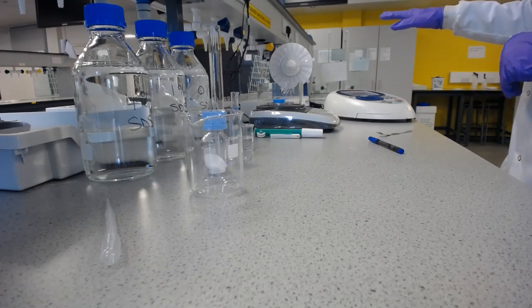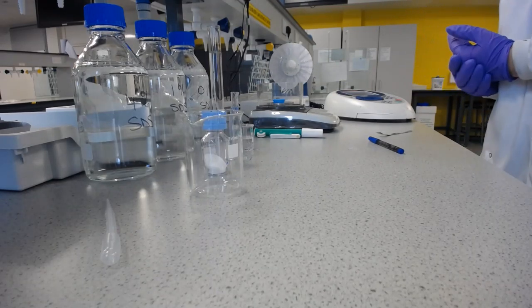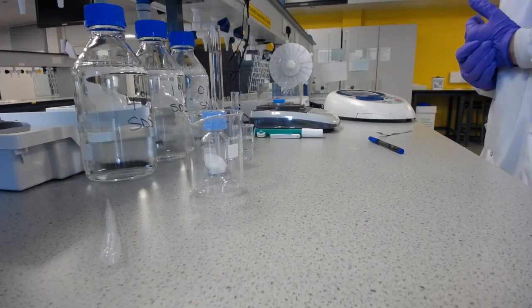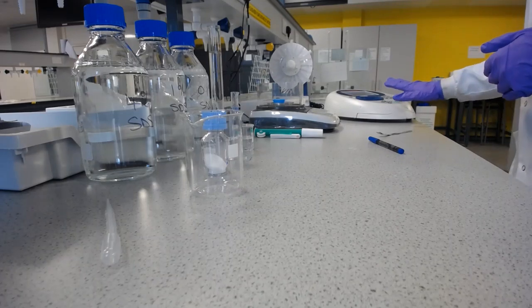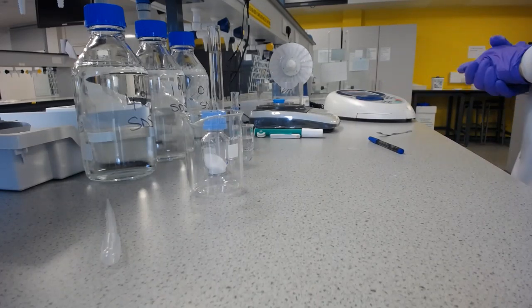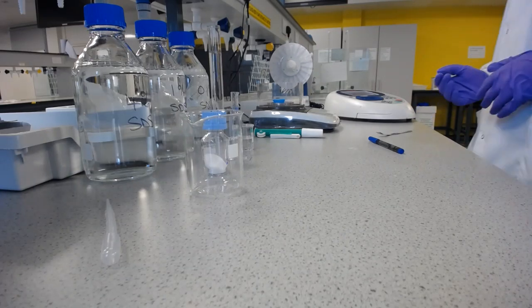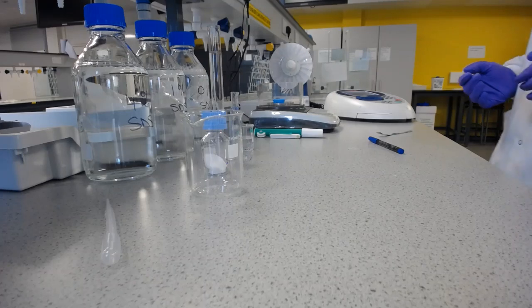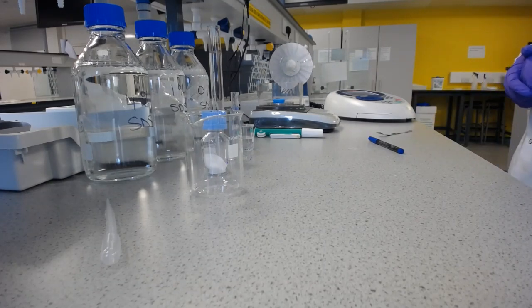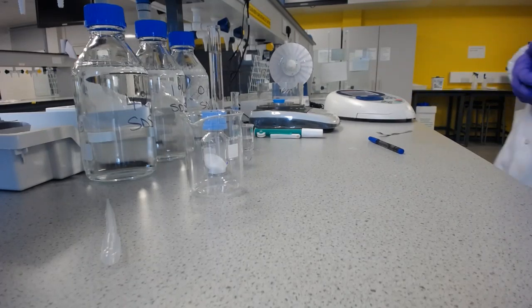So now they're mixing. When they're done, we're going to want to be able to determine how much aspirin is in each solution once we've filtered off the excess. And to do that, we're going to use the UV-Vis spectrometer, and we'll dilute the solution, put it in there, and we'll get an absorbance reading. But the absorbance reading on its own is no use to us. We need something that tells us what does that absorbance reading mean. And what we'll create as that decoder is a calibration curve.